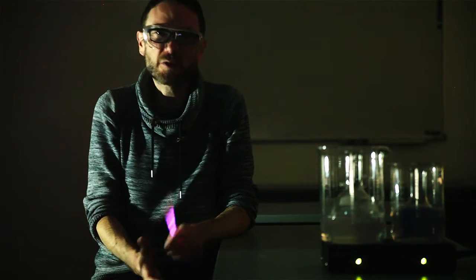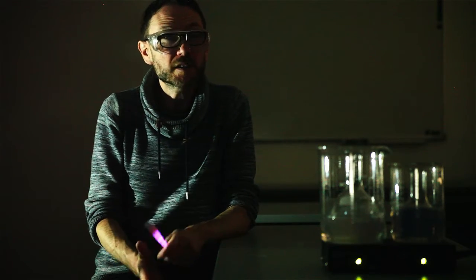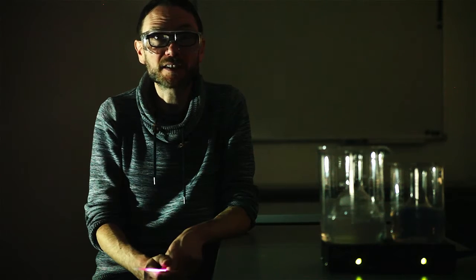At room temperature, the reaction will continue happily for about an hour, but you'll need to wait a few minutes between flashes, not great for a captive audience, but nice maybe to leave out for a STEM club or a similar event and allow people to be surprised by it.